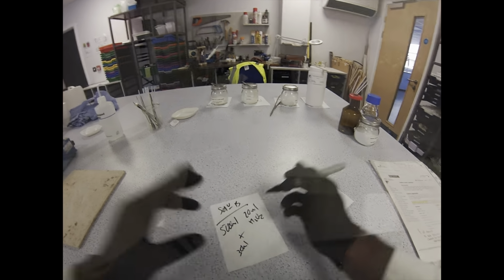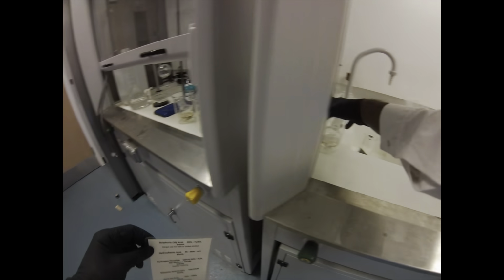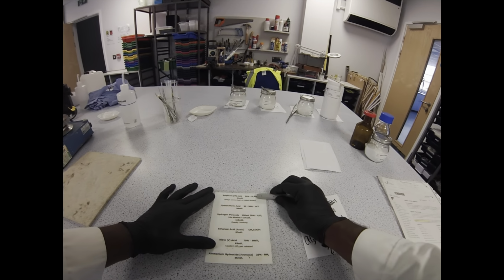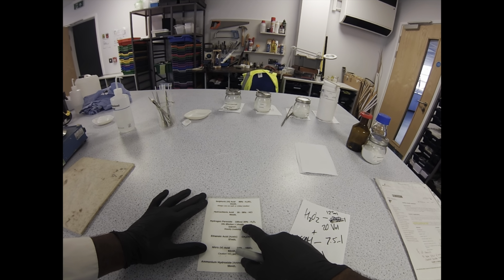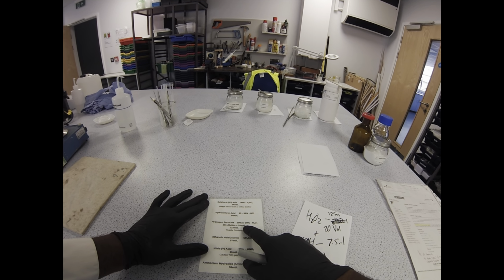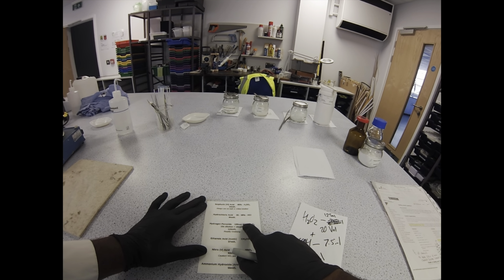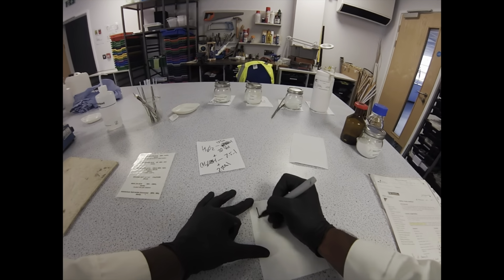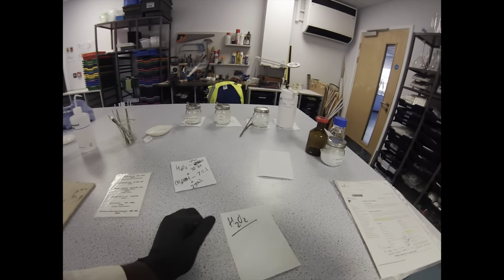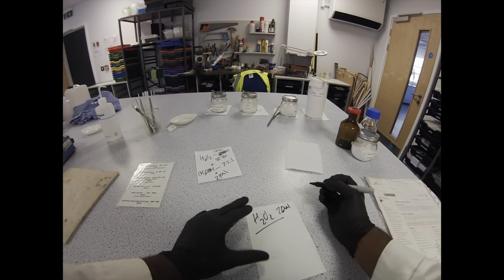The thing with hydrogen peroxide is it's slightly different to how you buy a lot of your other liquid reagents, in that you don't really buy it as concentrated. You buy it in vol. The vol is short for volume, and in this context, vol is an indication as to how much oxygen the hydrogen peroxide can release. It's normally sold as diluted rather than concentrated. It's highly oxidizing and highly corrosive, so it's a little bit safer to use and handle.